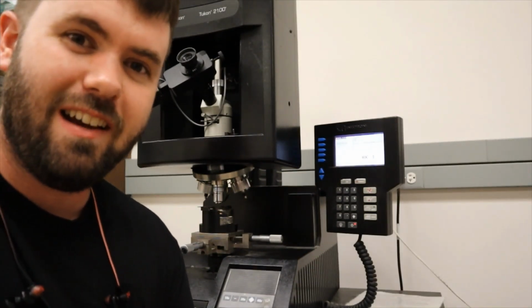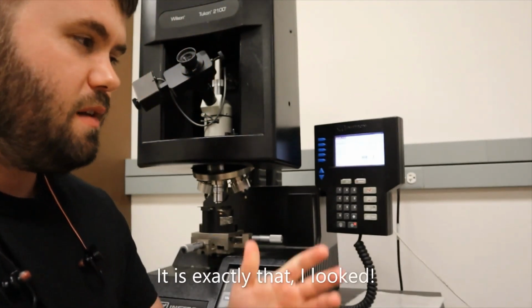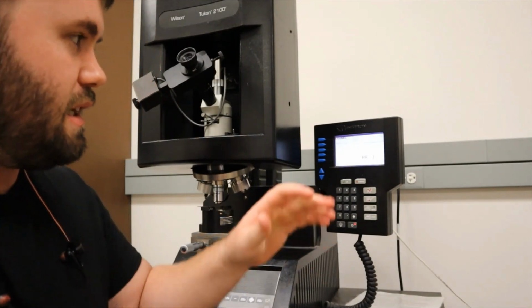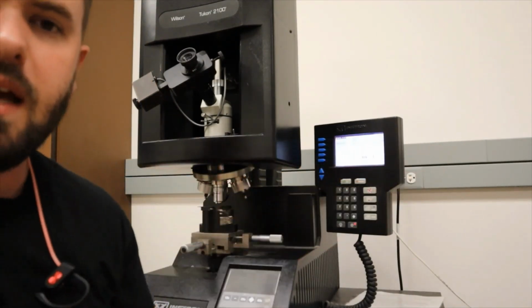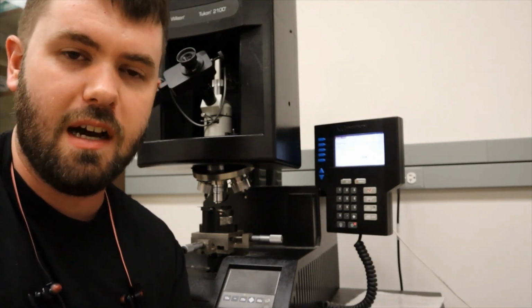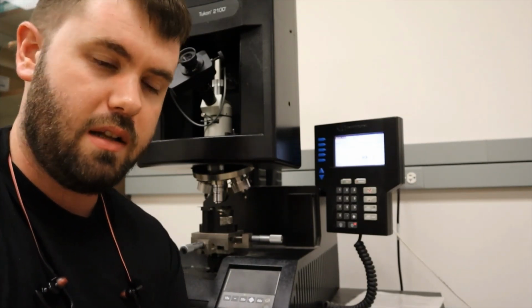Feel free, please check that on your own time. Don't trust me that it's exactly that. But because we're not calculating crack length at all, we're just measuring the diagonals, we can actually calculate hardness with the machine itself. That would give us hardness values, which, if you were doing this experiment, really speeds up the time because you don't have to take your sample over to the optical microscope to measure the crack length.